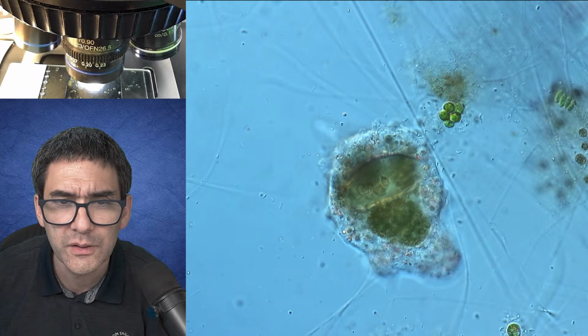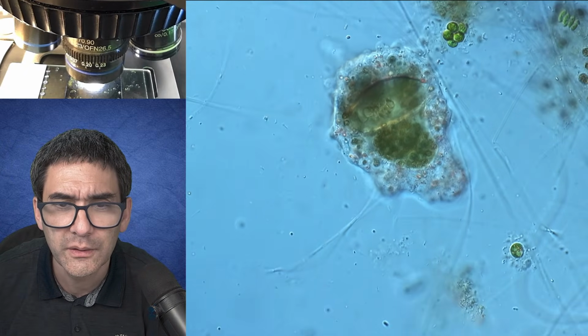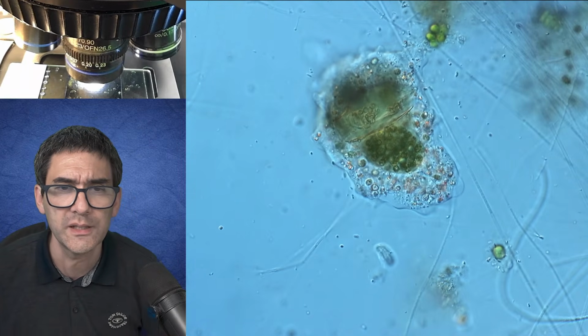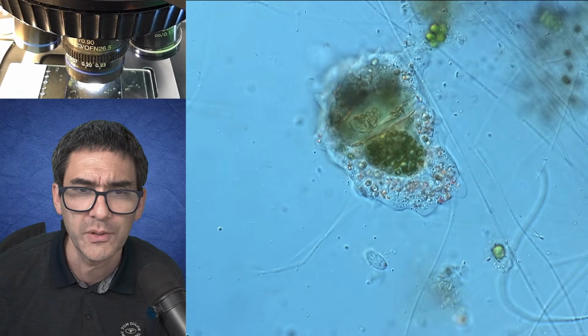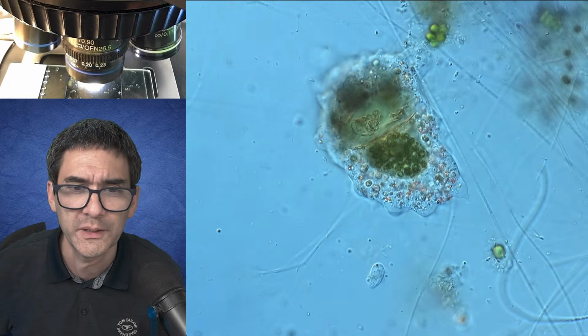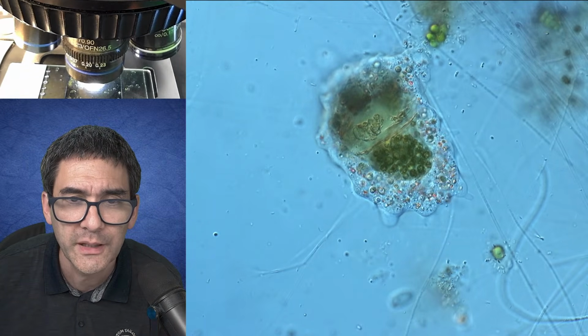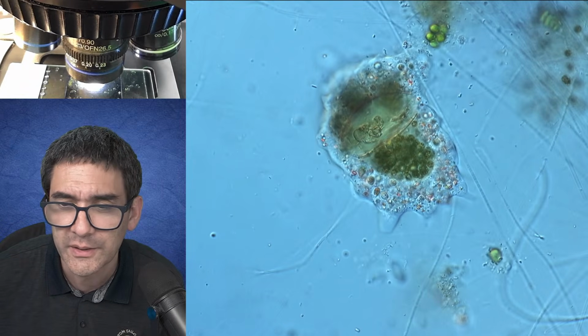Yeah, you see, those amoeba are actually quite nice to make time-lapse videos of, because when you speed up the movement, you can see much better how it starts to crawl along. But that is of course quite nicely visible.